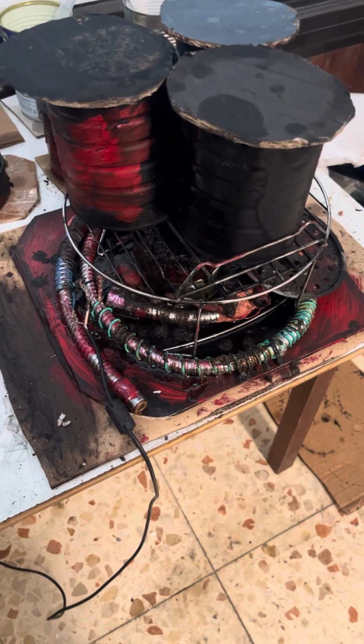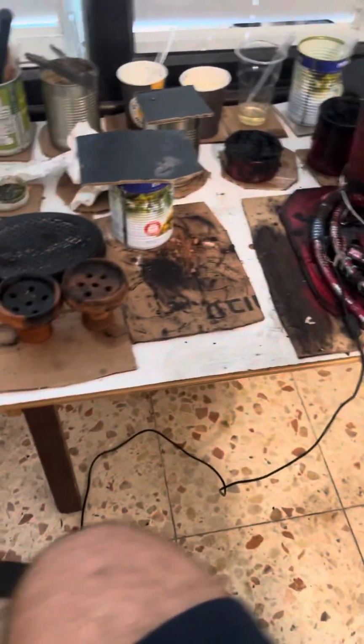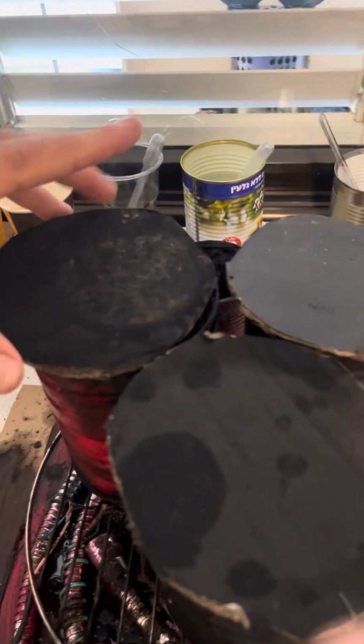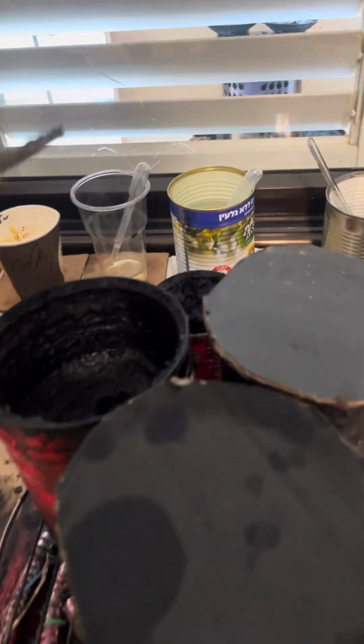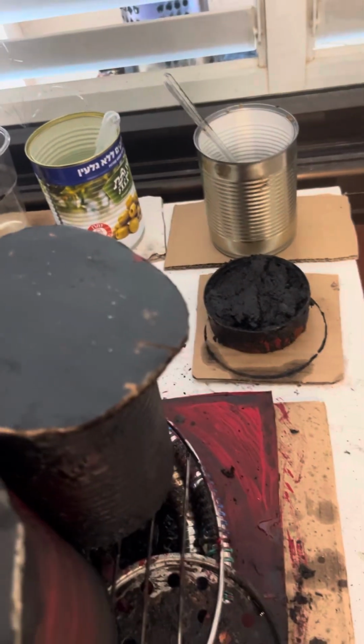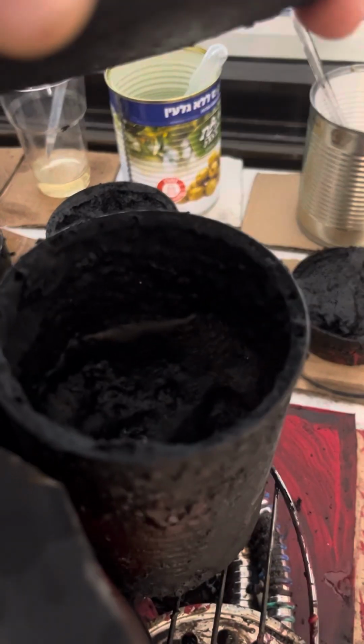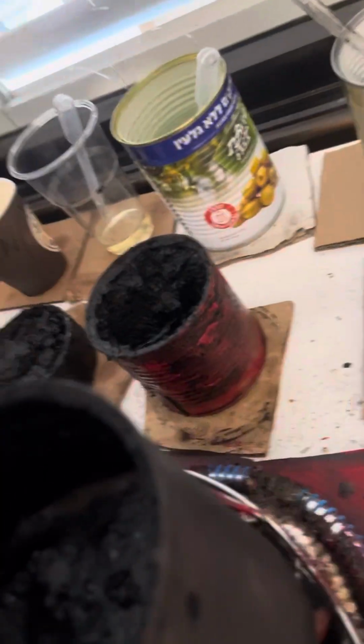Good morning. So this will be yet another microscopic examination, 2 slides. It's the same crucible, with small updates, mostly with regards to the symbolic language. Not critical ones, but still, even though last time we saw significantly larger trained bacteria, which is the purpose of this culture, and also a great amount, and obviously trained bacteria, not ambiguous identification, I was still not completely happy.